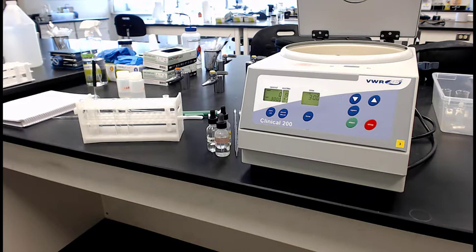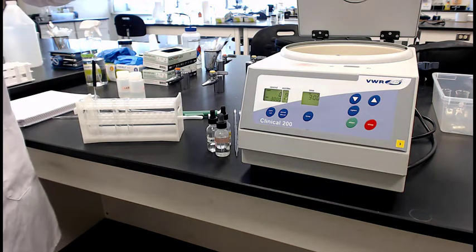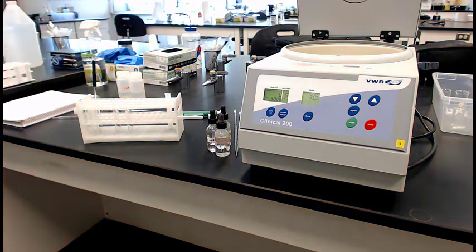So now what we want to do is actually separate. In chemistry 111 you did the same reaction and you could filter that solid off, but what we're going to do in chemistry 2 is balance our test tubes and make them the same height. So we're going to take a blank tube. That's what he's doing right now. He's making a blank tube the same height as that white precipitate tube with just water. And this is just a counterbalance for the centrifuge. It has nothing to do with the chemistry.